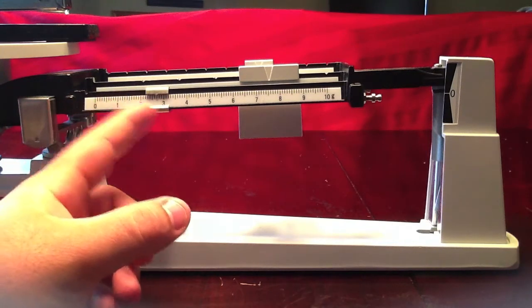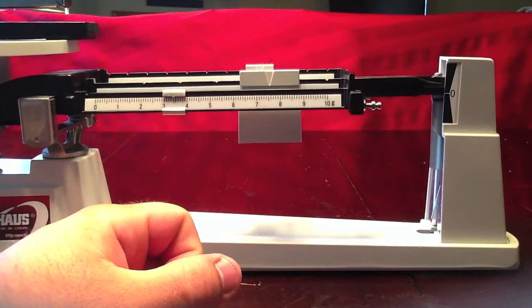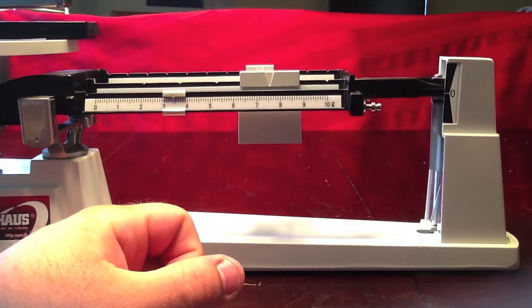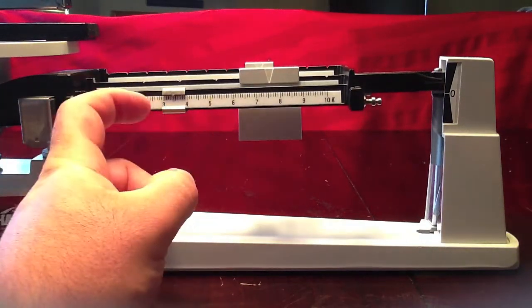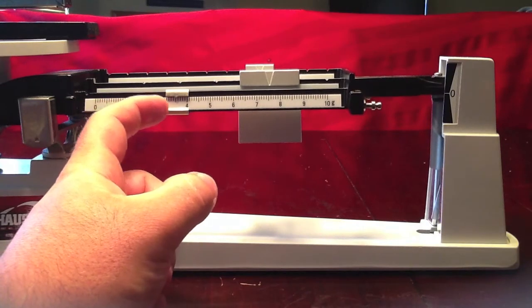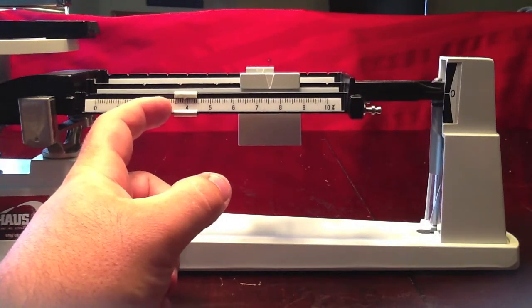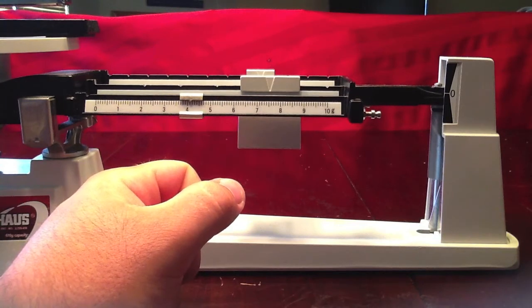Because we want the balance to be even at the zero, slight subtle movements are best to avoid disrupting the accuracy of the scale.